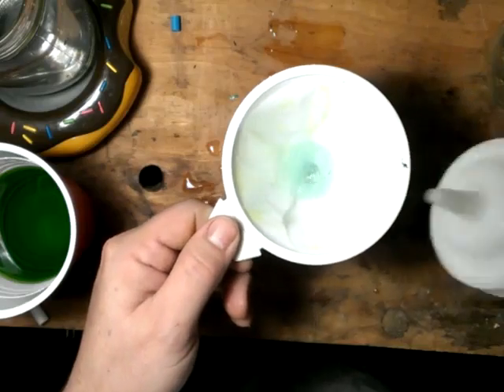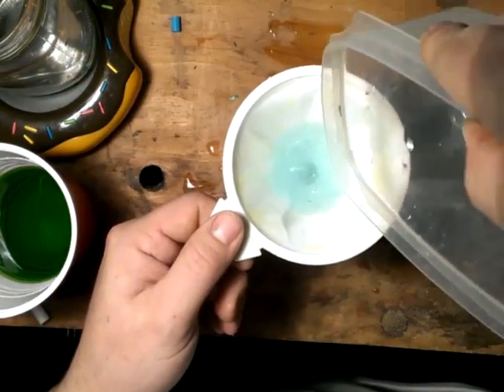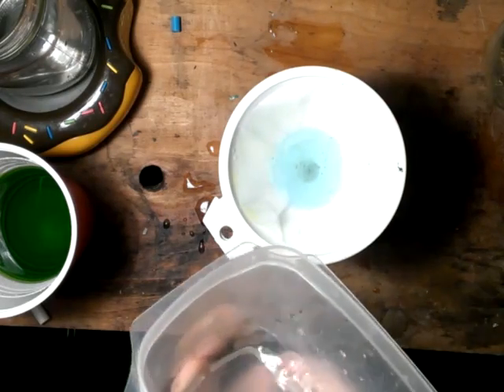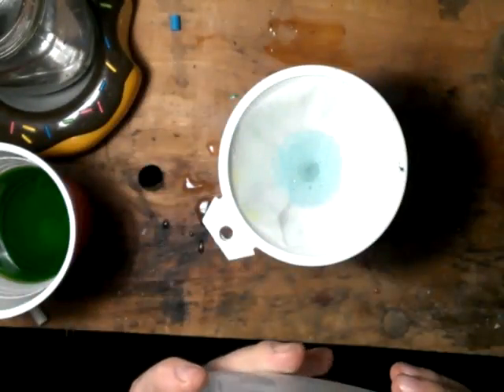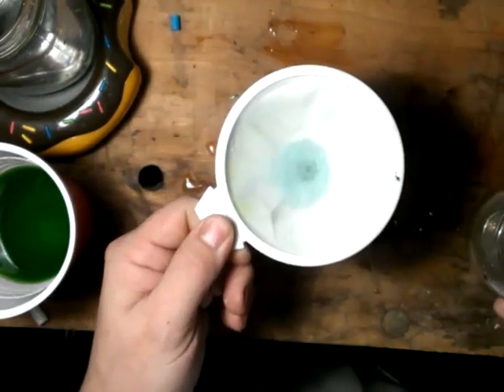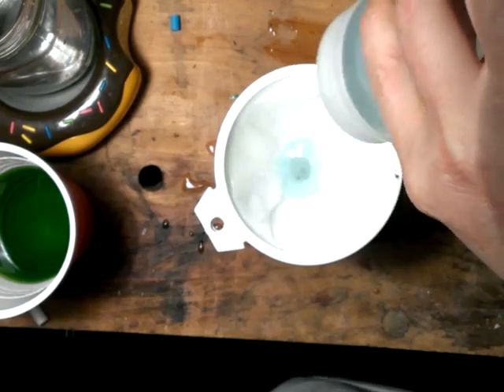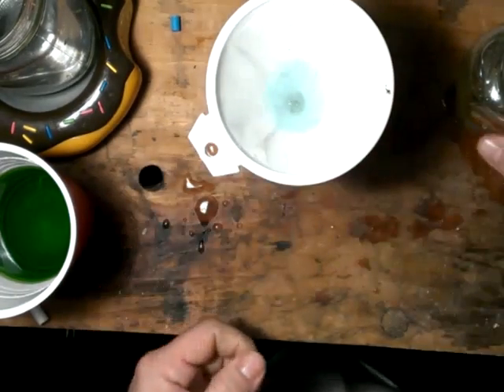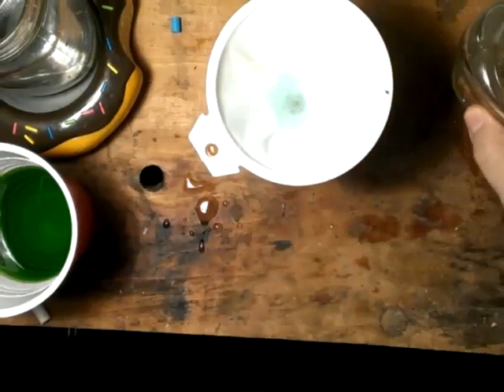I'll start rinsing this up a little bit. Get this in here — there's a couple of flakes in there floating around. Get those guys in there. Filter it out. Got some gold stuck on the side — I didn't even notice that. Get that in there. You can see this water shows a little bit of a blue tint to it — and when it still has color, it still has chemicals. It needs to run completely clear — like this. That's how you know you've got rid of all your chemicals.